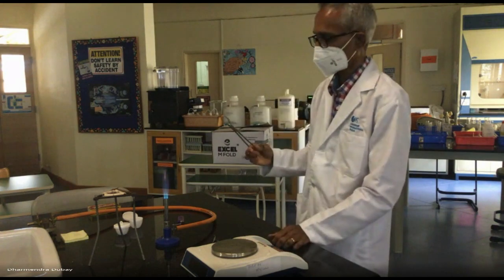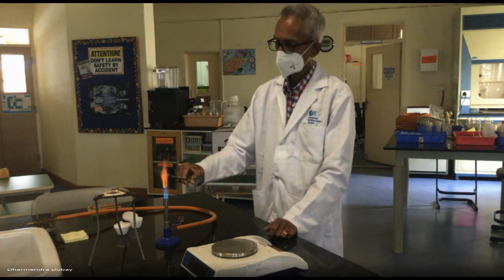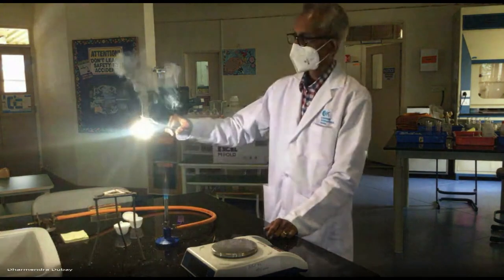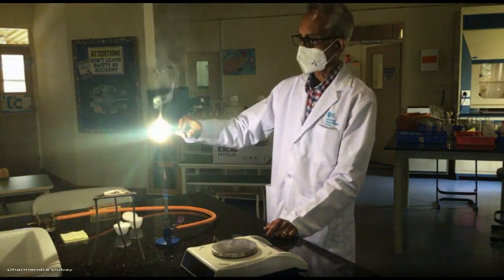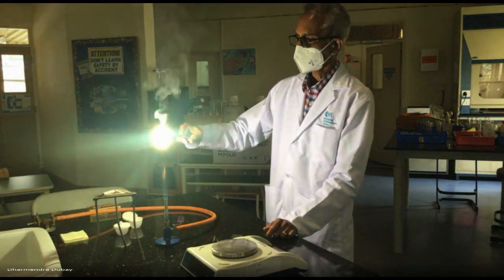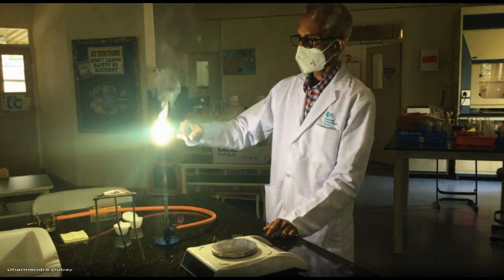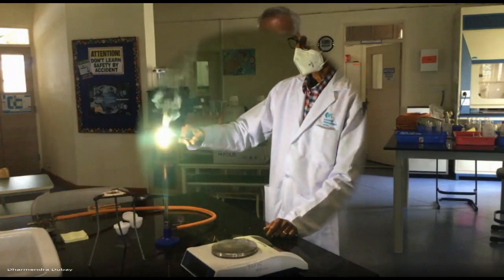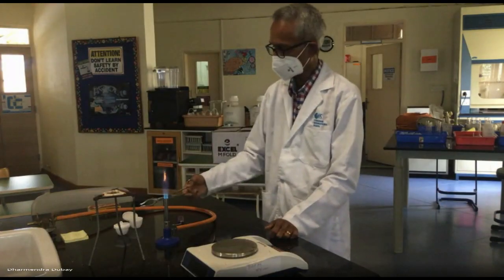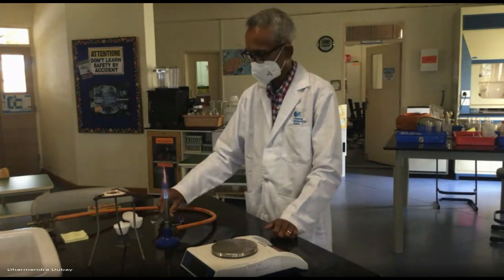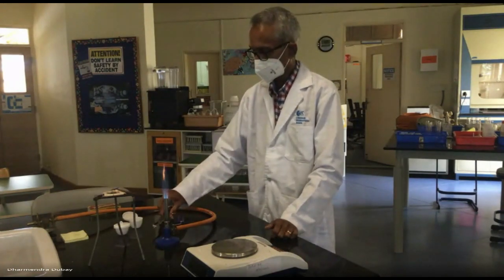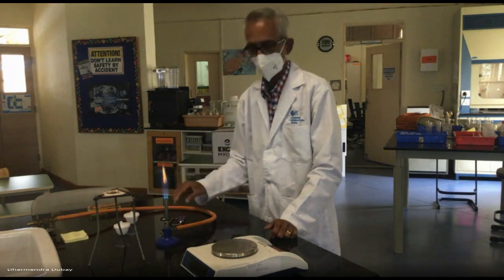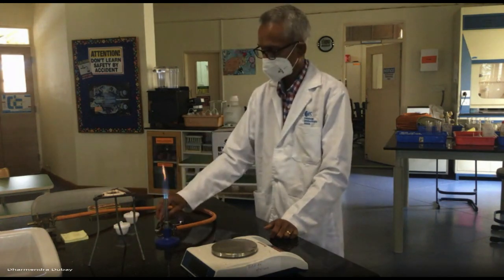So I am ready to burn the magnesium ribbon. You can see it has bright light, and you can see the smoke coming out of it. What do you think will happen to the mass of the magnesium ribbon? So let's find out what has happened to the mass.